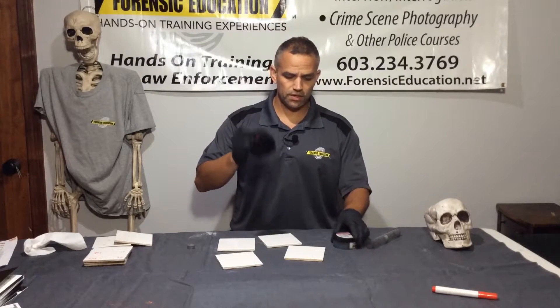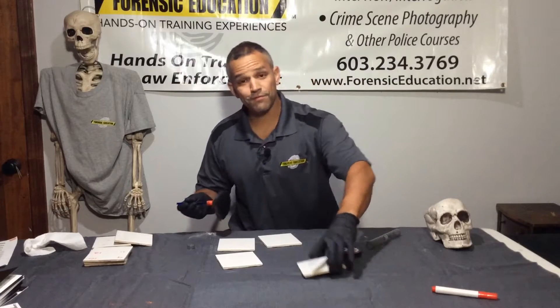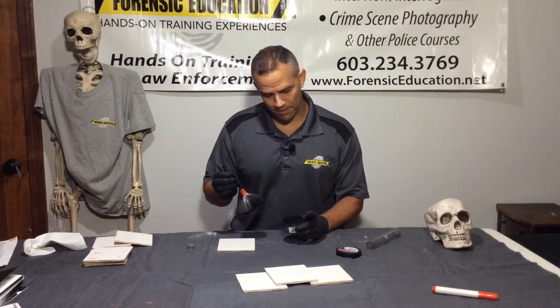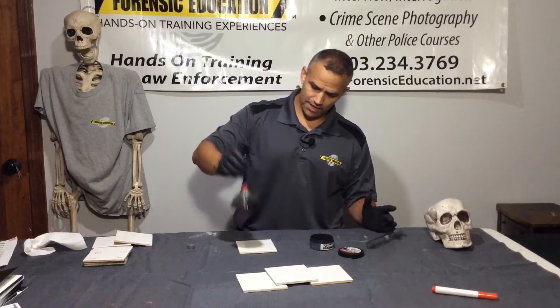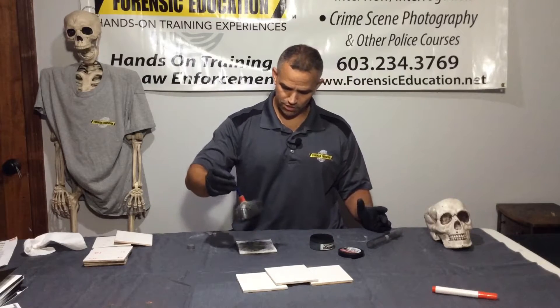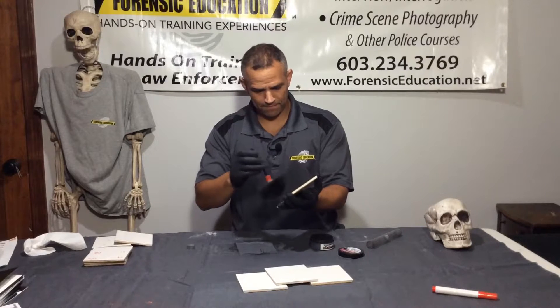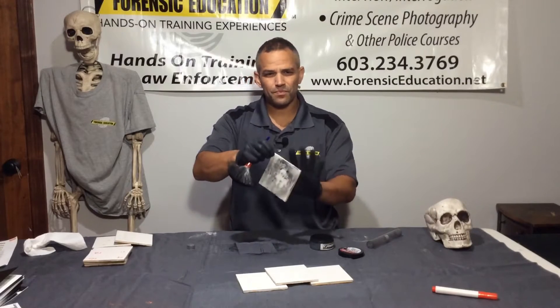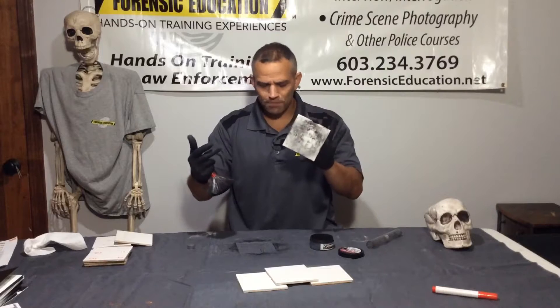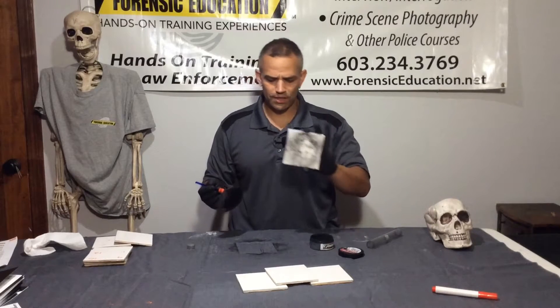The first thing we're going to do — it's going to be a big mess — using too much powder. This is not a paint bucket, so we're not dipping like this. Oh, this is going to be a mess. Then I tried to develop my print... okay, I can see a fingerprint here, but look at that — I've colored the background because I've used so much powder.